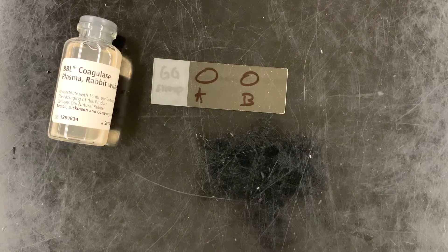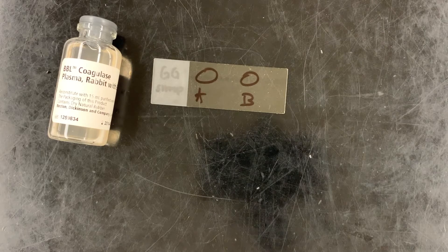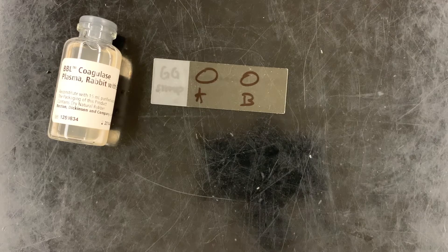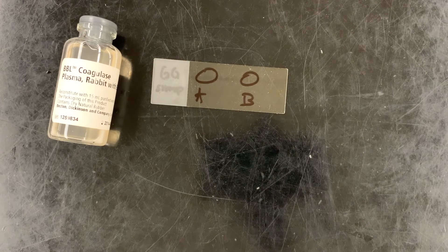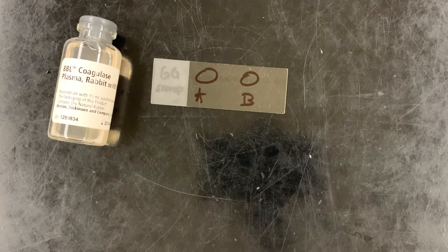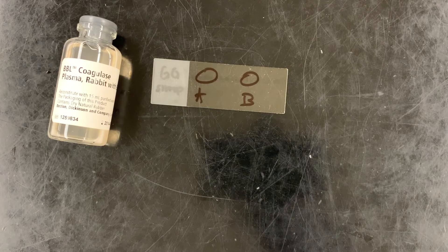We're going to use this as a presumptive test, because the test itself will tell us so much more. Pathogenic staphylococci — or at least presumed pathogenic Staphylococcus aureus — will produce coagulase, whereas non-pathogenic Staphylococcus generally doesn't produce coagulase. So we're going to look for that, and it'll tell us so much more because it's a presumptive test.